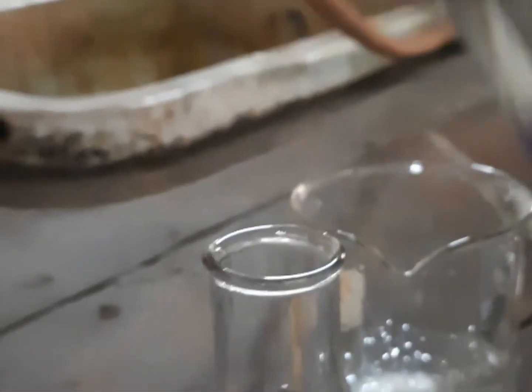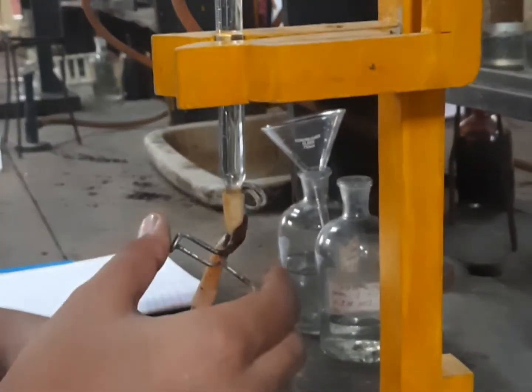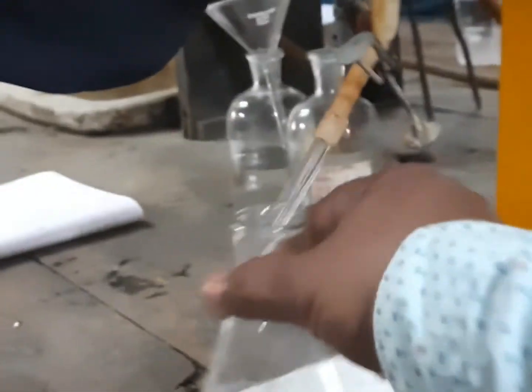Add 2–3 drops of phenolphthalein indicator. When adding the indicator, take care as sometimes a drop may not fall out, so it may be more than 2–3 drops — don't worry. The pink color will be observed, which is due to sodium carbonate reacting with phenolphthalein. Now add a few drops of HCl solution from the burette and slowly observe the color change. It becomes colorless — note the reading, which is 1.8 cm³.